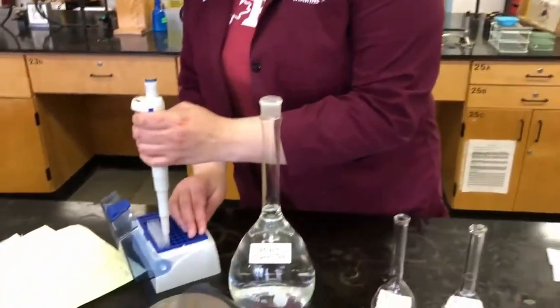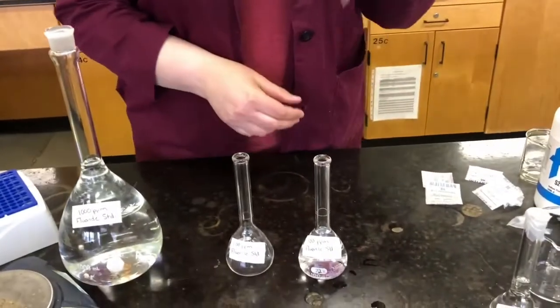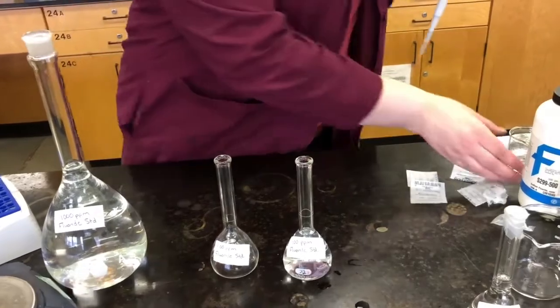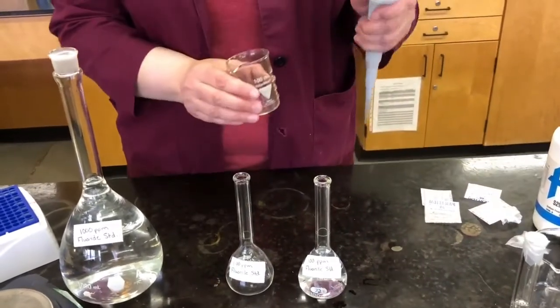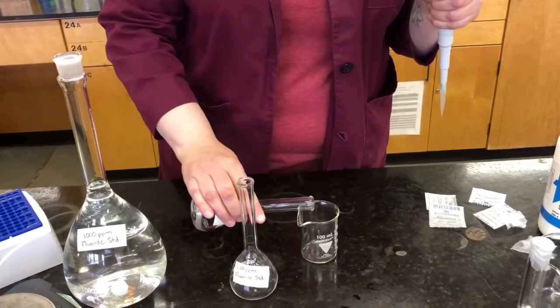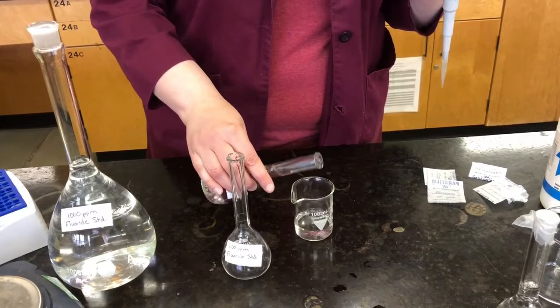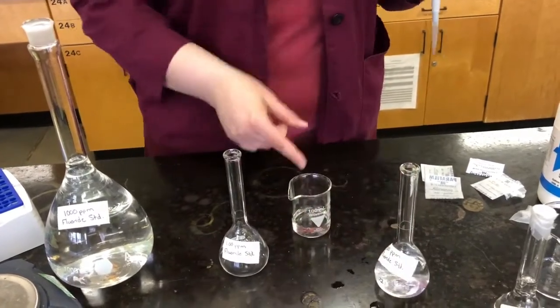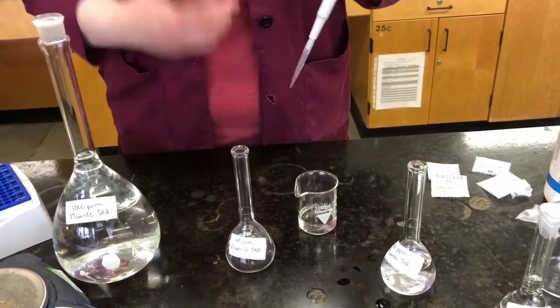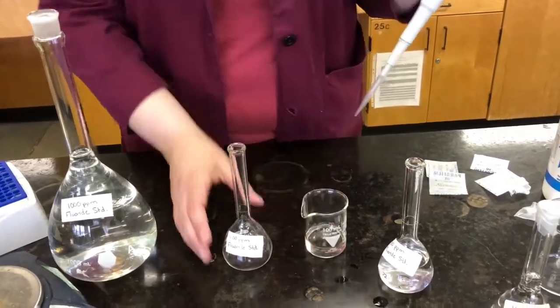So we just get a tip, pipette, make sure it's on there. Now this is not going to fit down in the mouth of that flask. So I'm going to take a clean, dry beaker. I'm going to pour a little bit of my stock solution into that. You want to make sure your beaker is clean and dry. It's important that it's dry because, of course, if you add any water to that, then you're changing the concentration, and we don't want to do that. We want accurate concentrations. So we're going to make sure the beaker is clean and dry.